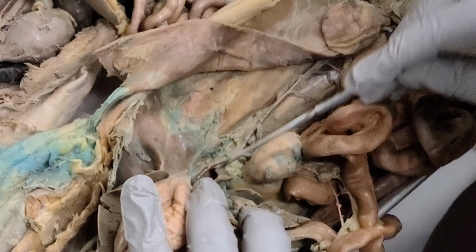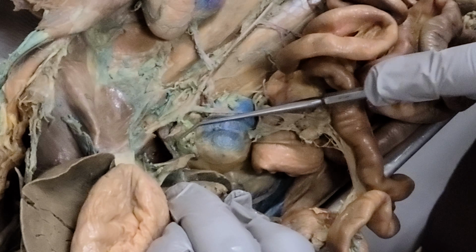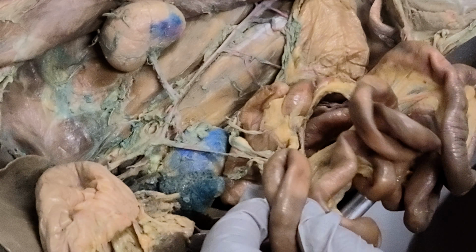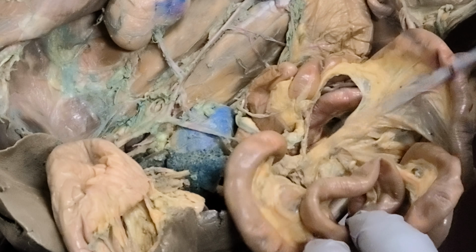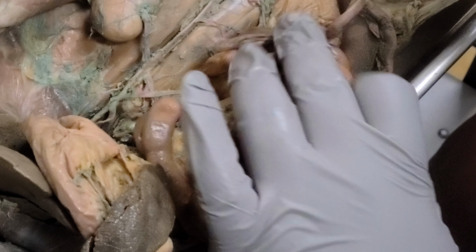All right, so the abdominal aorta in the center. Oh, I don't see celiac, so celiac's been cut off. See, celiac. And then what would this one be? The superior mesenteric. It goes into the small intestine, mesentery proper. And then this one leading into the kidney. It's renal. Renal, good.